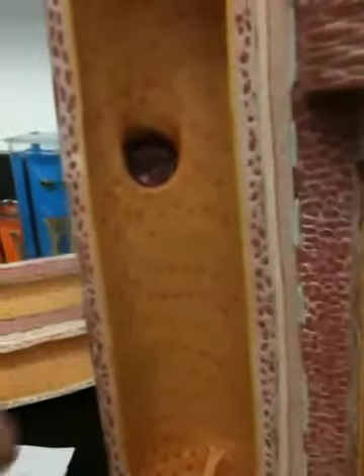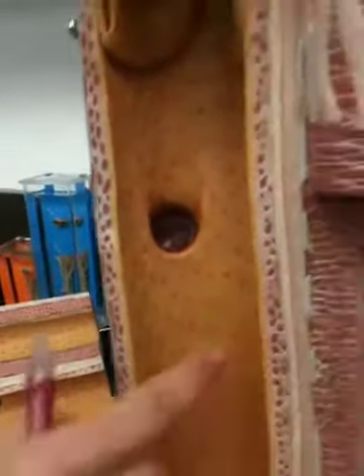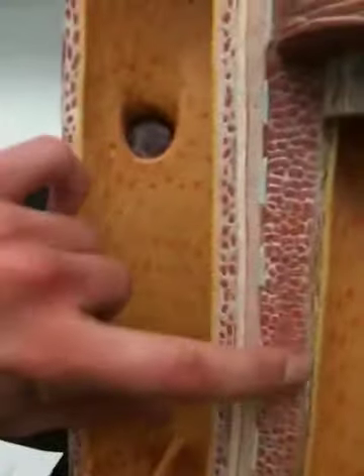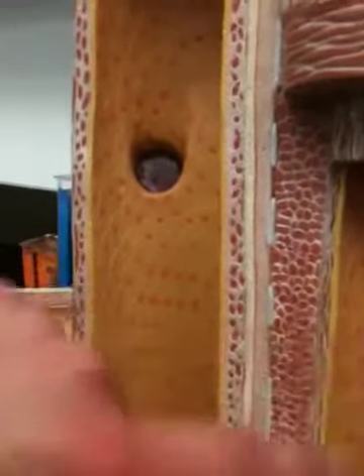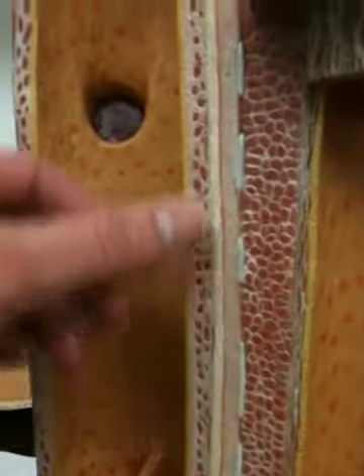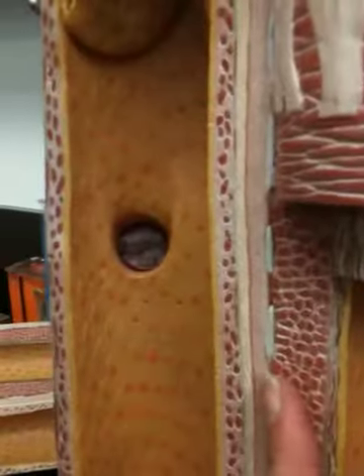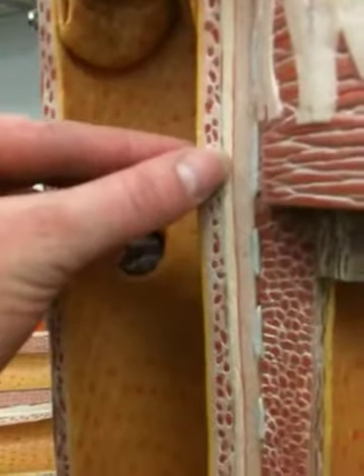Nothing there. Okay, so is this the basal lamina? Basal lamina would be at the bottom, between the yellow and the red. Right, so the basal lamina holds the endothelium to the connective tissue, to the smooth muscle. So here we have the layers: the endothelium, the basal lamina, which together are the tunica interna, and then we have the tunica media. The tunica externa would be the pink thing right here, and then I don't know what comes in between here.